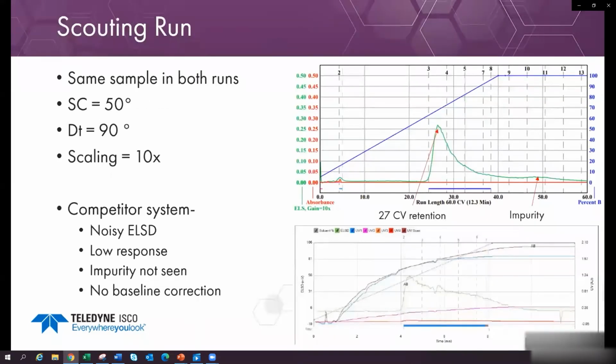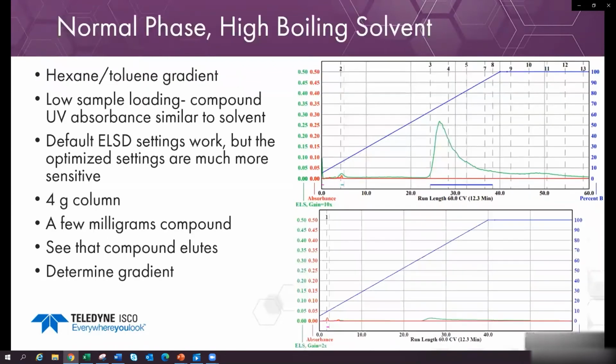Both runs in this slide use the same sample. The mobile phase was hexane toluene, high boiling point. In the CombiFlash Next Gen, we could adjust the spray chamber, drift tube, and gain to get a nice clean run. The Next Gen has a smooth signal and can detect an impurity eluting late in the run. A competitor system that does not have this control gets a signal with a relatively low response. Changing the settings greatly improves sensitivity and recovery.